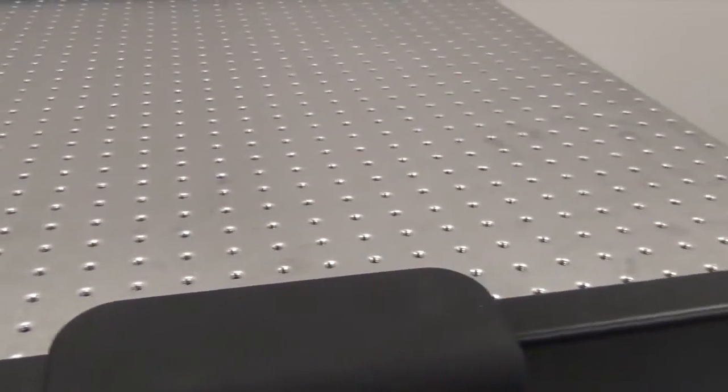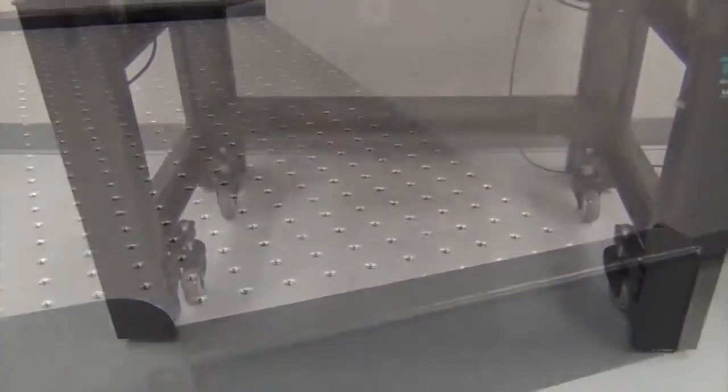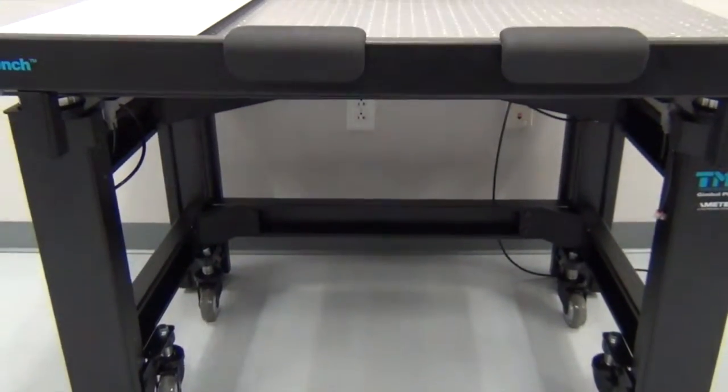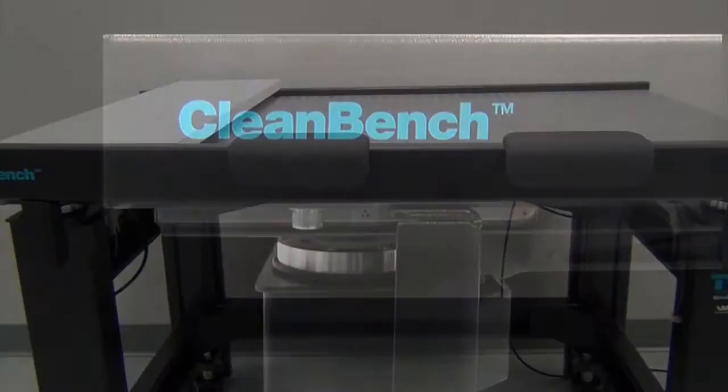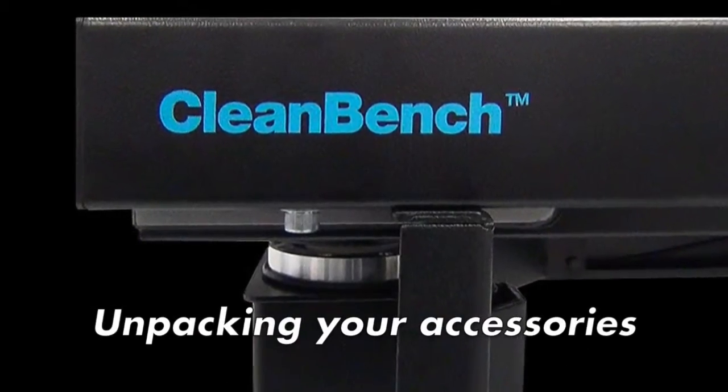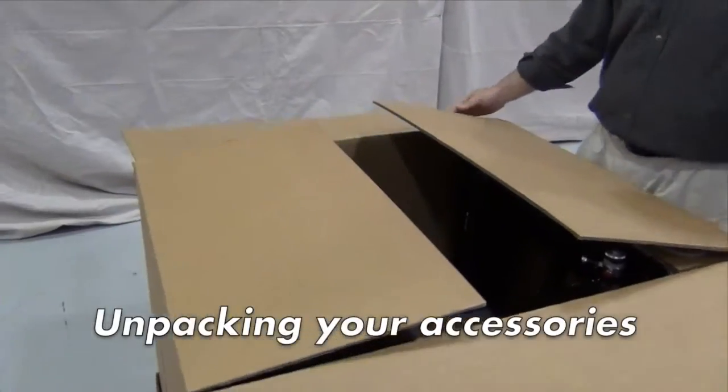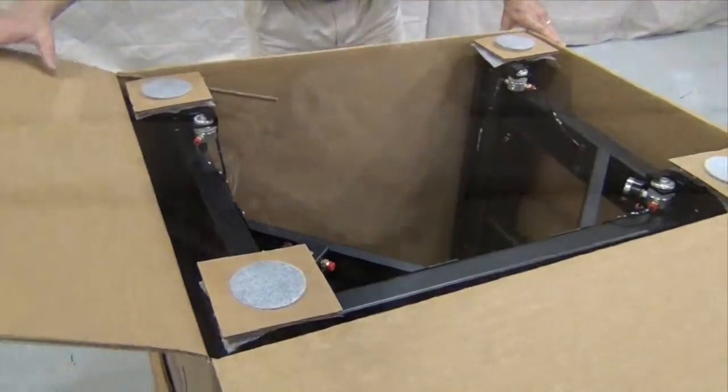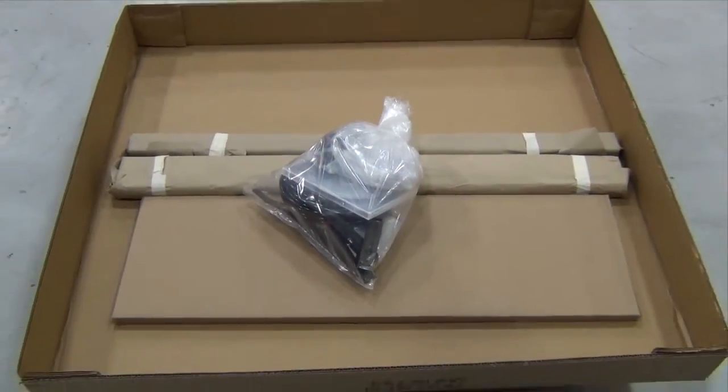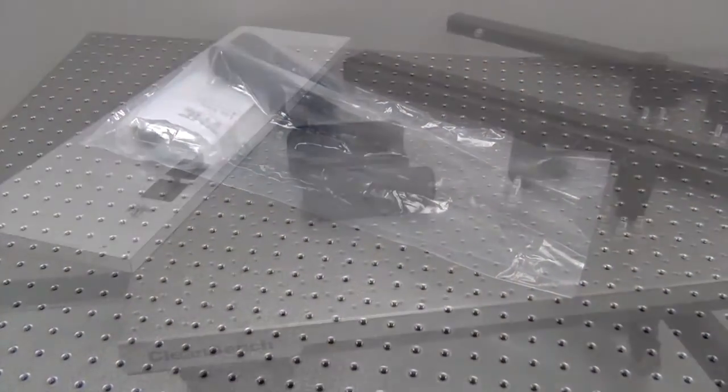Remember to work safely. When in doubt, seek assistance. TMC is available by phone to help with questions. The accessories are shipped inside the box with the CleanBench frame. Bracket kits are included in the hardware bag.